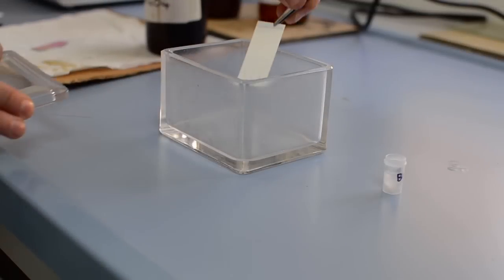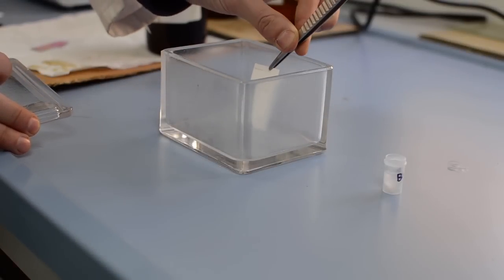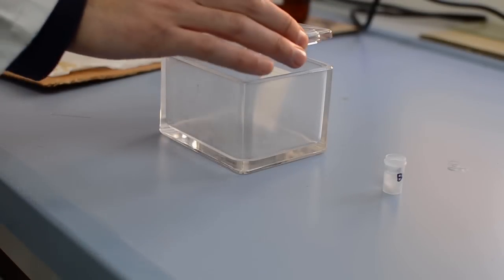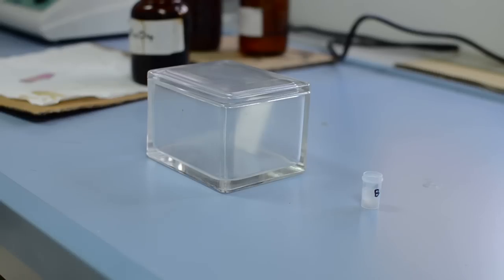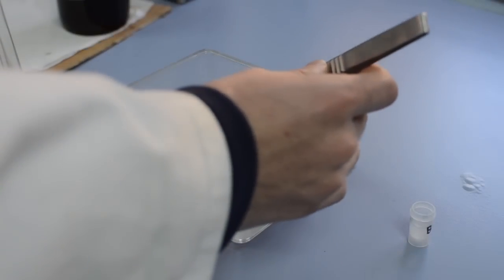Run your TLC in a solvent of your choice and develop the result once the solvent front reaches the top line. Compare the spots obtained and identify the components in the mixture.